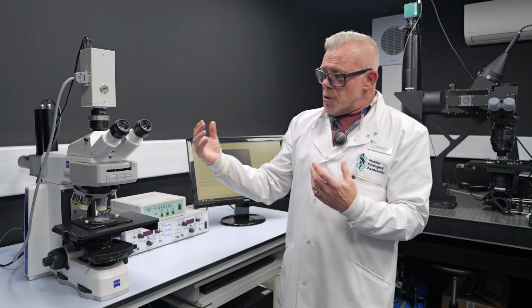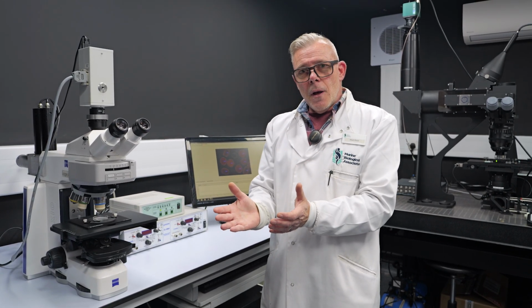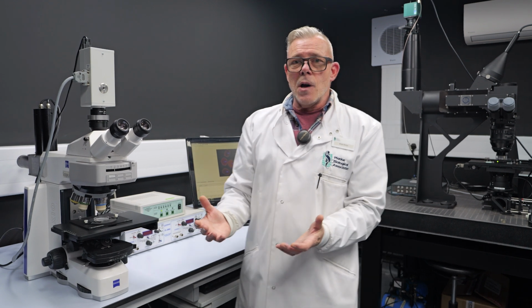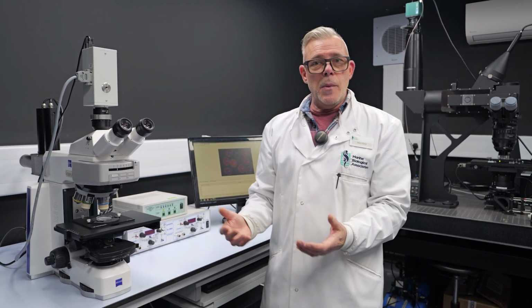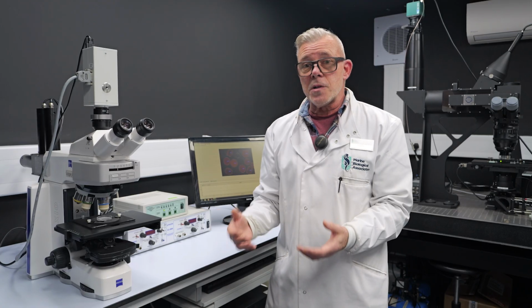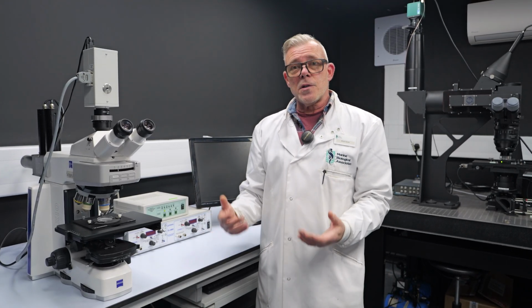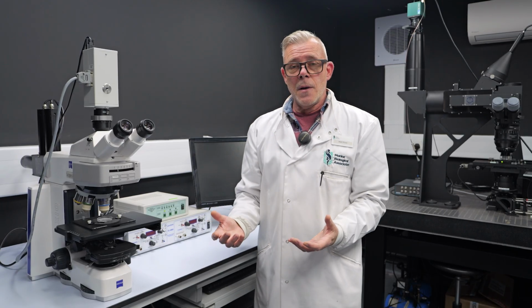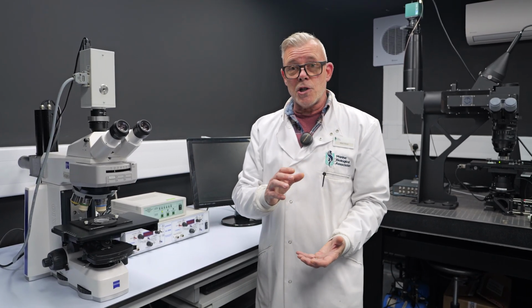Because traditional microscopes have a very narrow field of view, when we conduct these types of chlorophyll fluorescence analyses, we're only able to image a small handful of cells at any given time. And that makes it very difficult for us to start making inferences about phytoplankton photosynthesis at a population level.